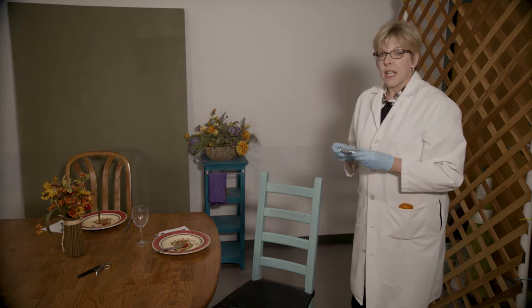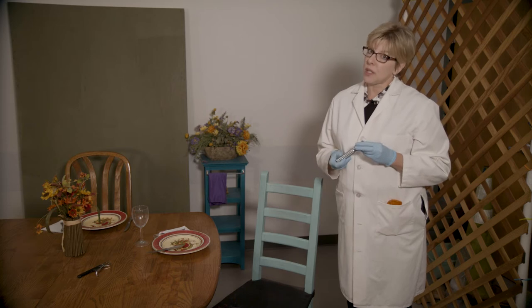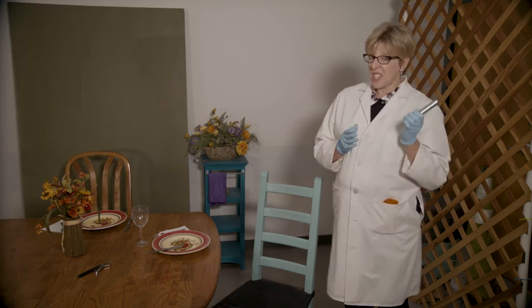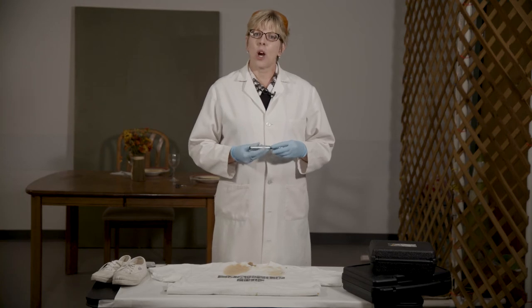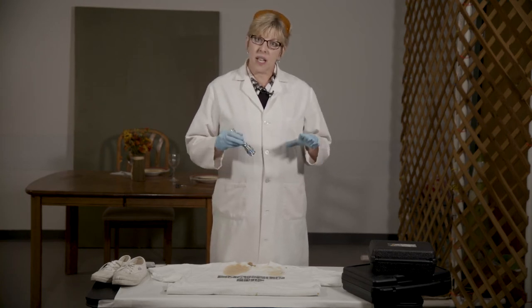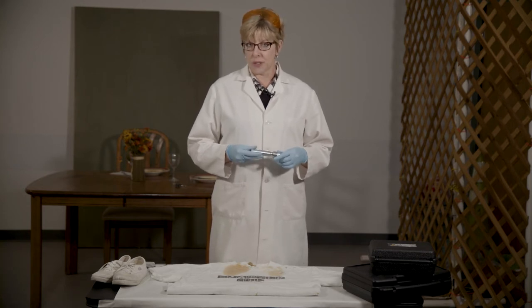There are a lot of different types of alternate light sources and a lot of different uses for them, and that's something we will talk about when we go back to the lab. So let's head back there right now and talk some more about the alternate light source. We are back in our laboratory area, and in this segment we're going to take a closer look at alternate light sources.